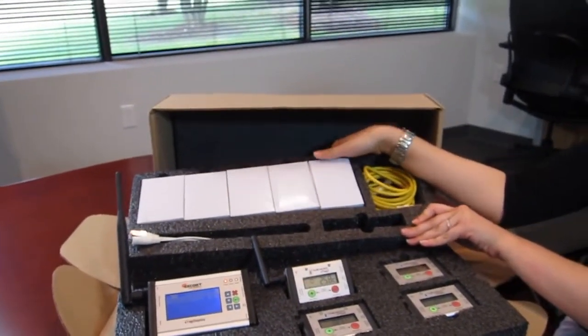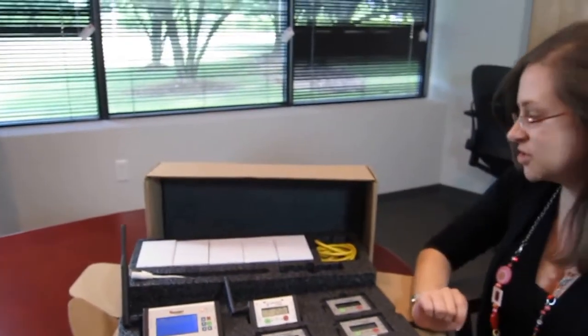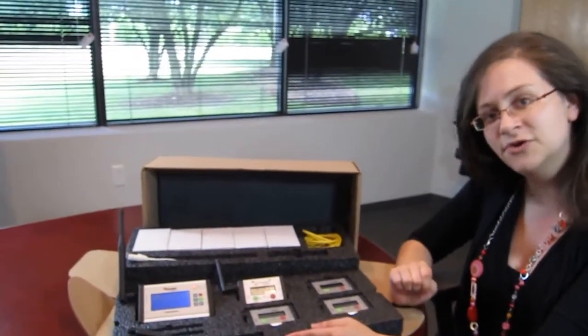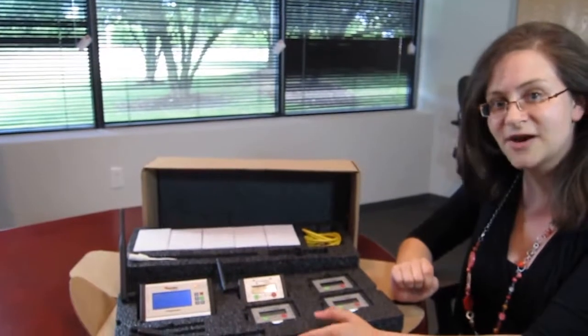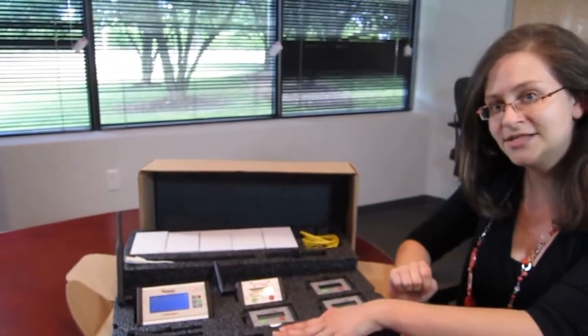This way, you are all set to be starting to record the temperature. We will also configure for you an account on Mirador Express, so that when you receive the kit, you are ready to go.